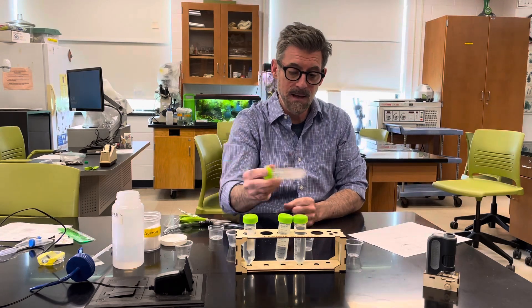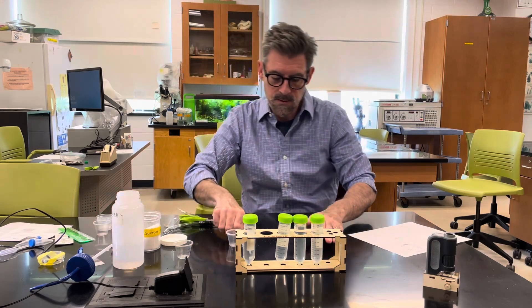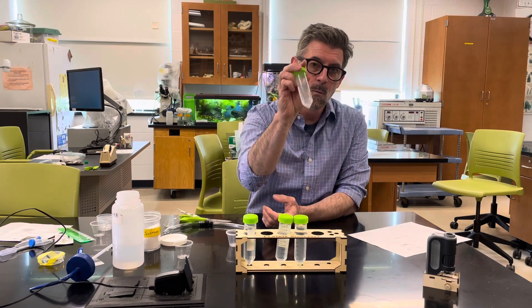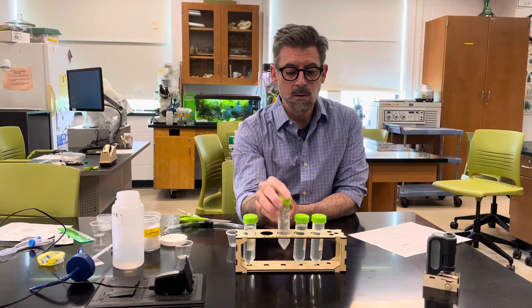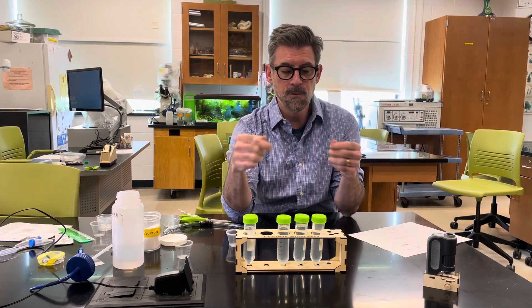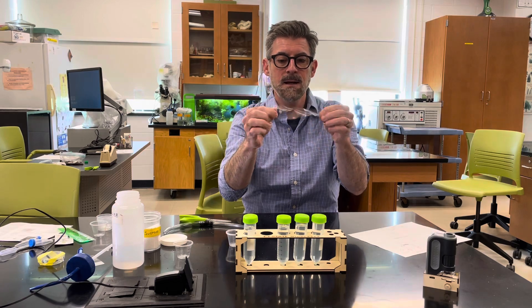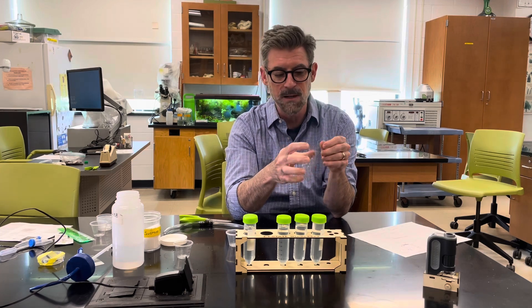That's the first part — getting your solutions made. Now move some things to the side to make more space. You're going to repeat this experiment three times: once for the one molar, once for the 0.5 molar, and once for the 0.25 molar. Each is a separate experiment: time passes, you record results, dump everything out, clean it, and set it up again. You'll have a piece of dialysis tubing in your kit that has to last for all three experiments.